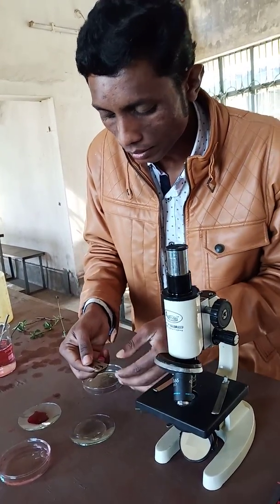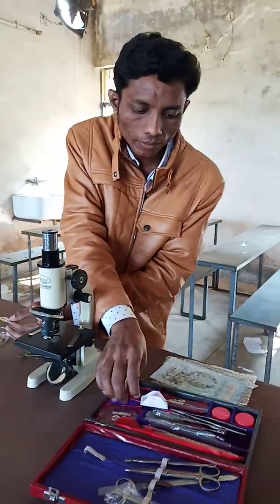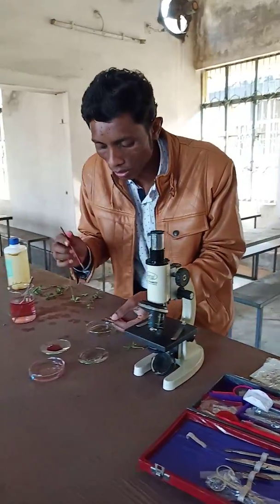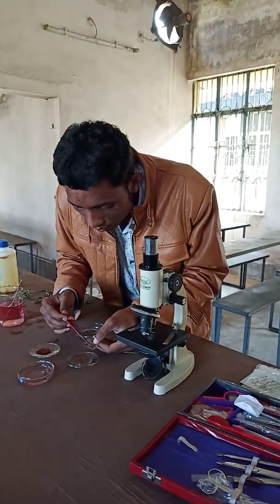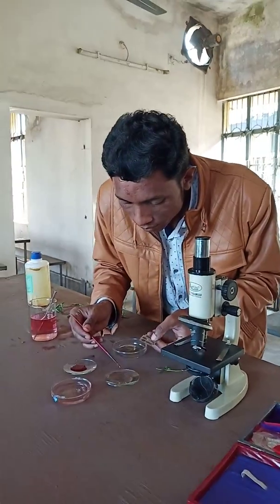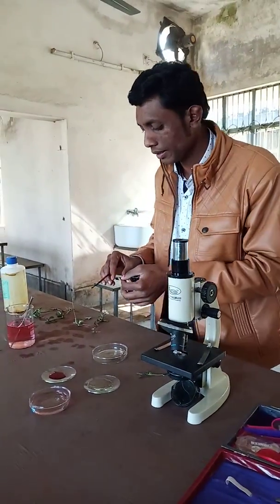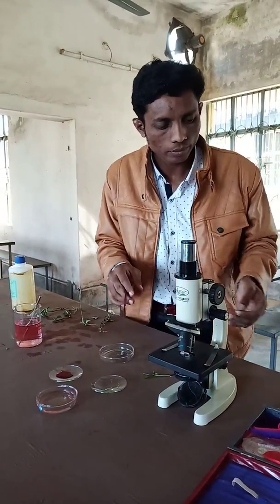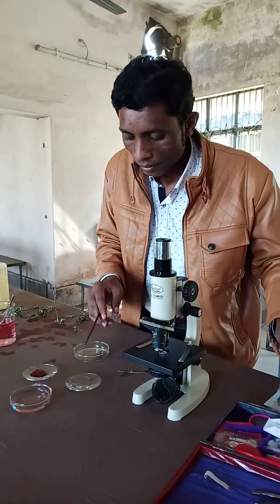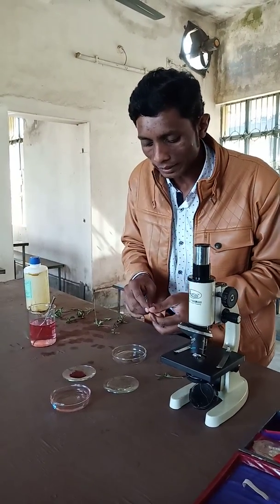Here we have taken some thin sections of Tridax Procumbens stem and we have put them in the watch glass containing water.